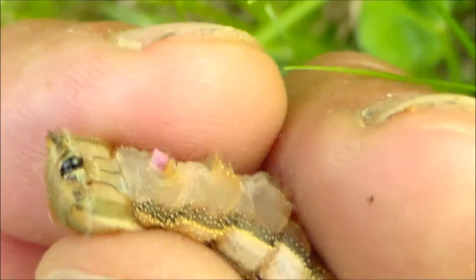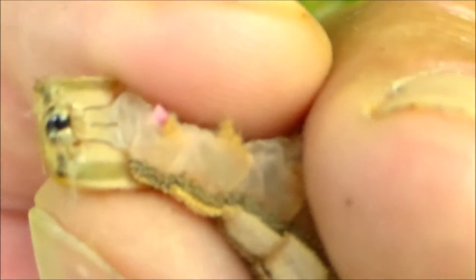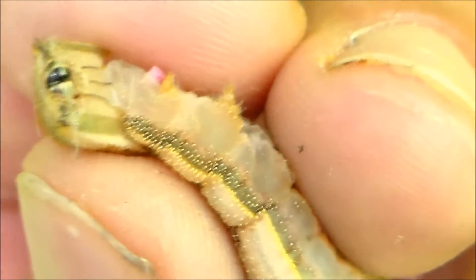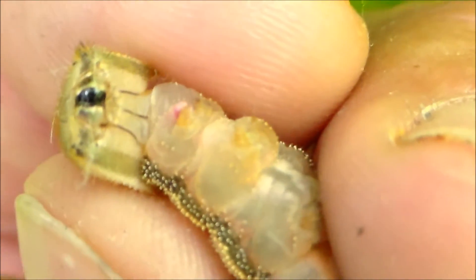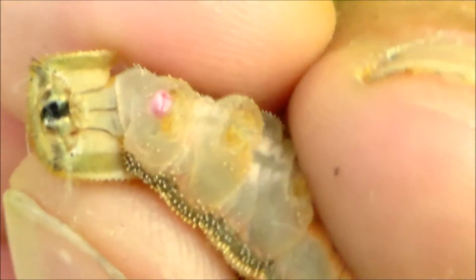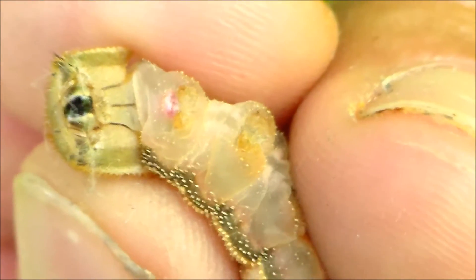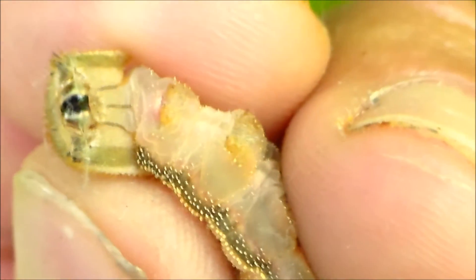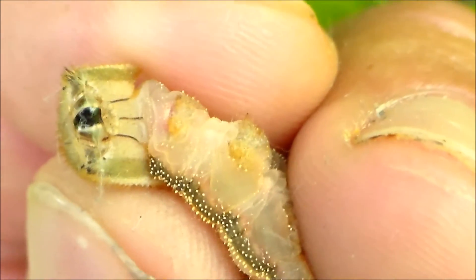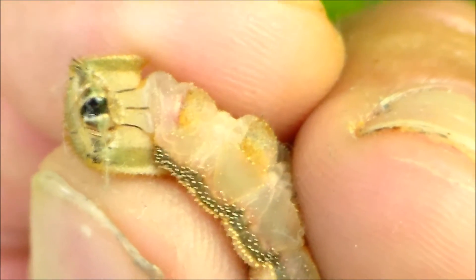This is an excellent shot. Sorry little guy — I have to stress you to show your organs. And now I'm gonna stop squeezing. So now the gland is going to head back into the body. And now it's barely visible because I aren't stressing it anymore, I aren't squeezing it anymore. So the gland inverts back into the body.